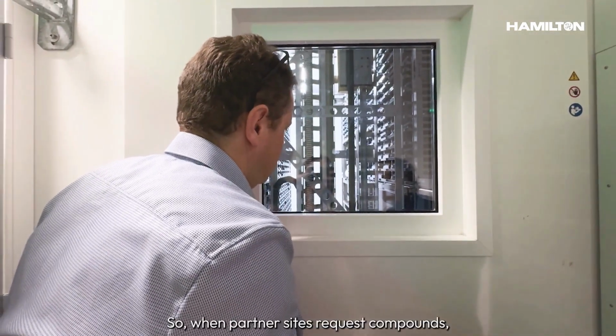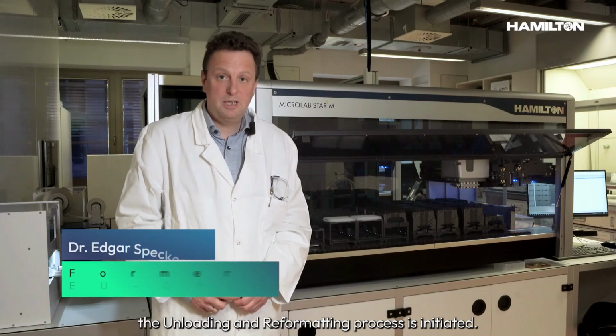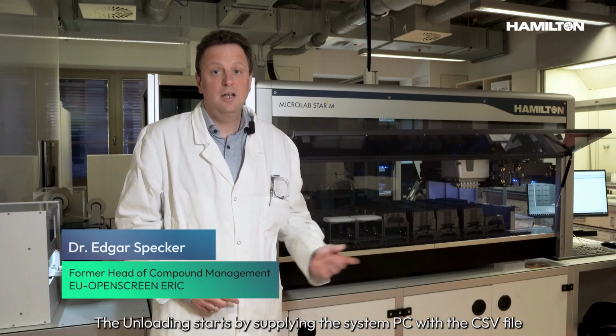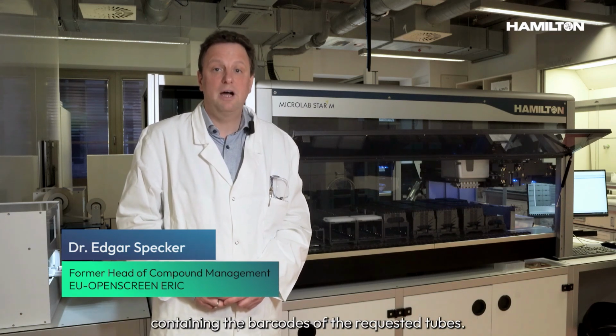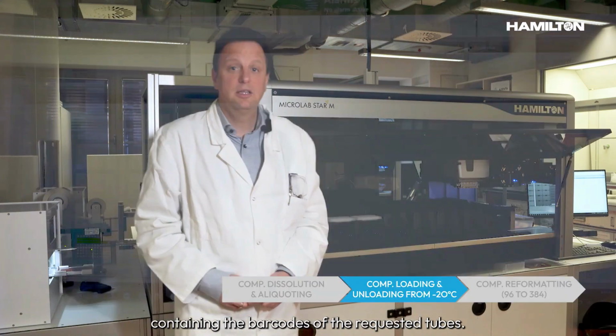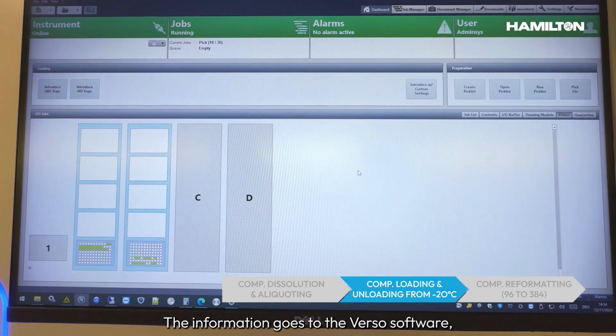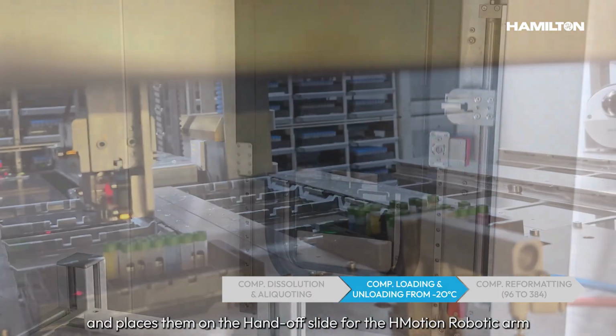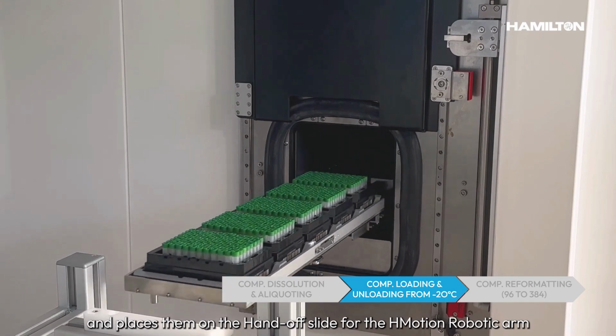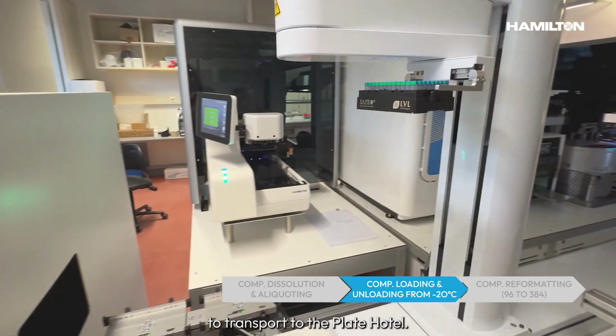So when partner sites request compounds, the unloading and reformatting process is initiated. The unloading starts by supplying the system PC with a CSV file containing the barcodes of the requested tubes. The information goes to the Verso software, which picks the requested tubes, sorts them into racks, and places them on the handoff slide for the H-Motion robotic arm to transport to the plate hotel.